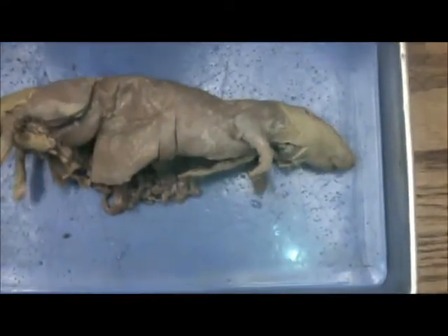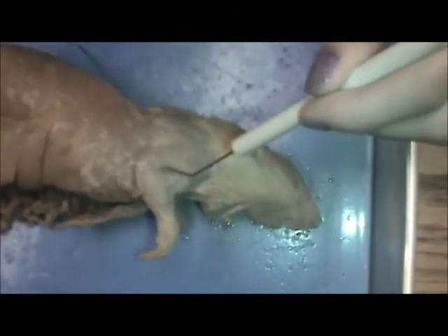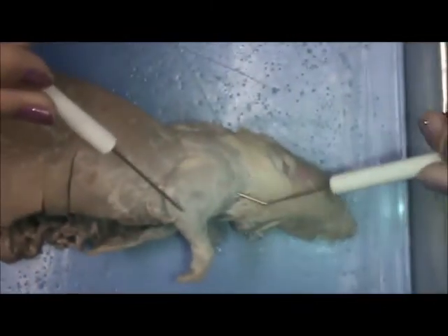Okay, this is Fernando's muscular system. First, this darker part right here is his biceps brachii, and that moves the forearm and flexes the elbow. Next is the triceps brachii, right here, and that moves the forearm and extends the elbow. This is the spinal trapezius. It moves the shoulders and neck, which moves his head.